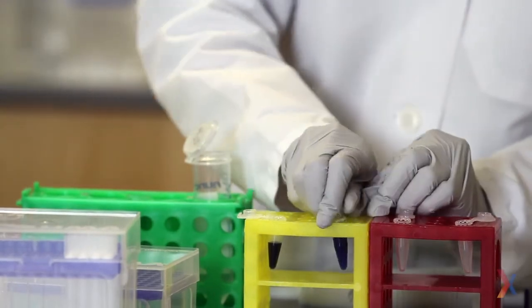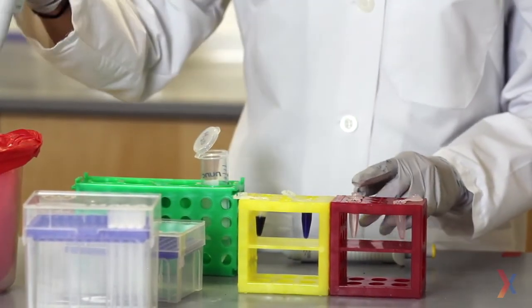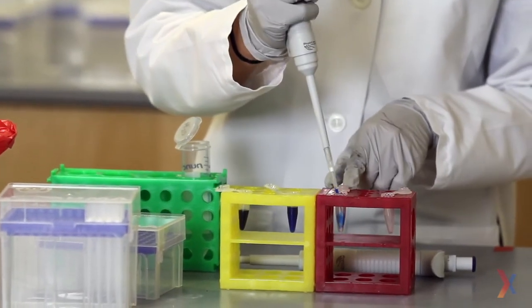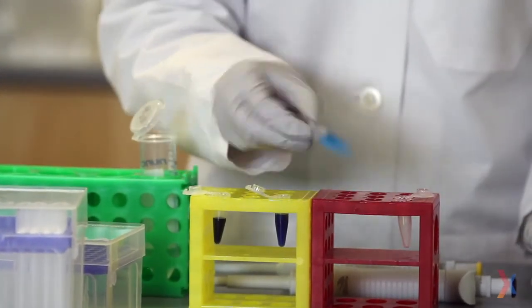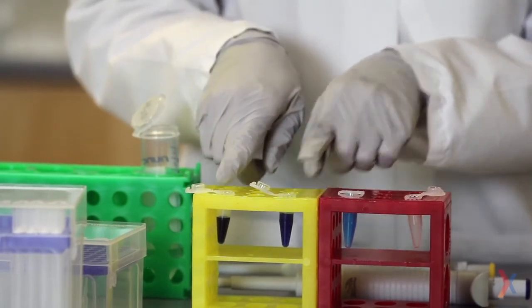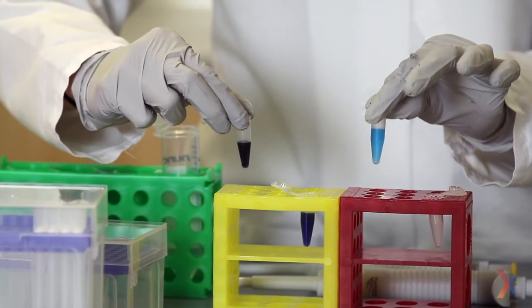I'm going to repeat the process again, taking 900 microliters of water into the third tube, and mixing that with 100 microliters from my 1-to-10 dilution I just did. I close the lid and give it a little mix, and you can see the color has become even more dilute. Now if this was a 1-to-10 dilution of the original stock, and then I made a 1-to-10 dilution of that, what I effectively have is a 1-to-100 dilution from the original stock solution.